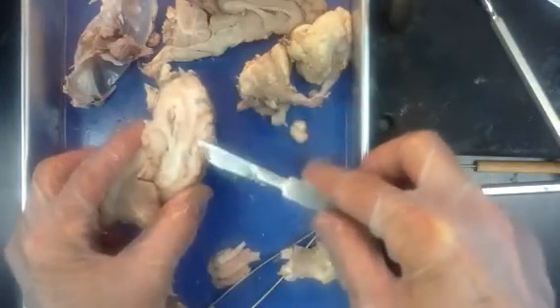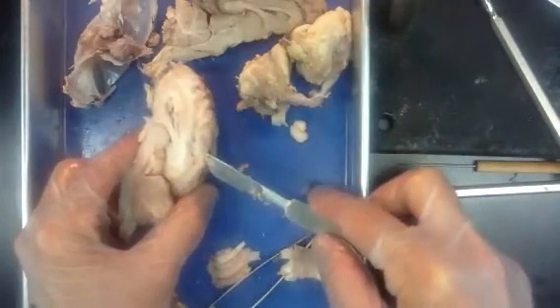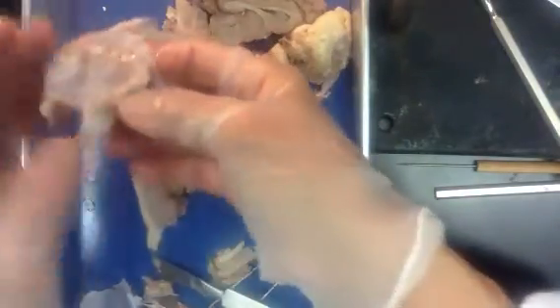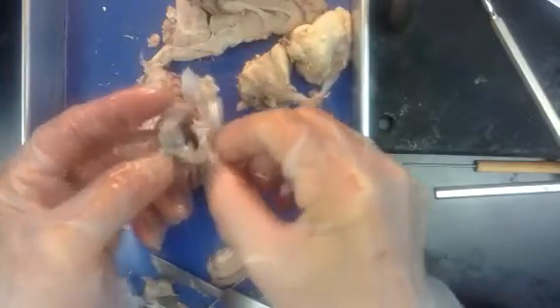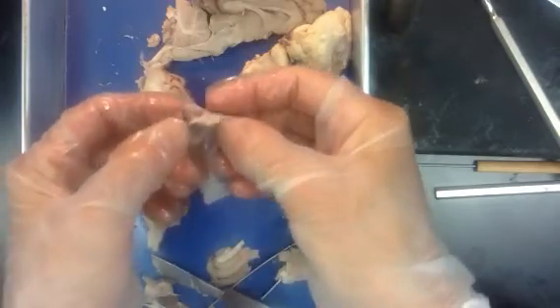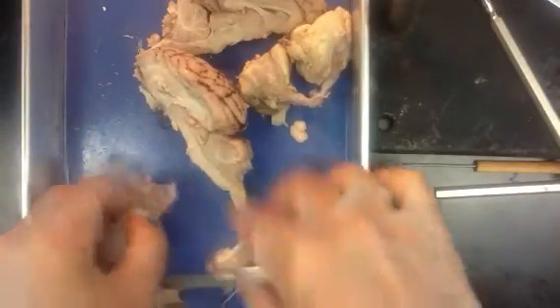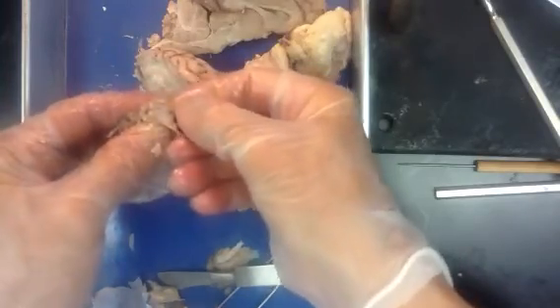At any rate, you can really see this white and this gray matter pretty well once you slice into it. I think we've covered most of our major stuff. On some of the brains attached on this dura, you will actually see there's a pituitary gland and a mammillary body may be stuck on there. So you may want to take that dura off of there and feel it. It'll be very spongy. Glandular tissue is very sponge-like. And so you can take a look at that.